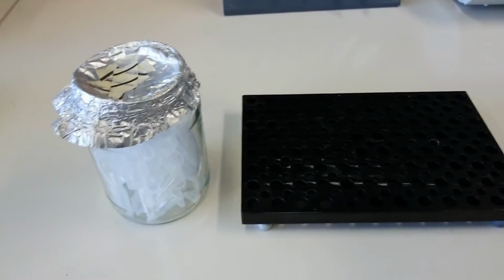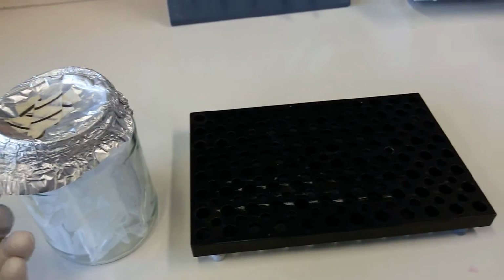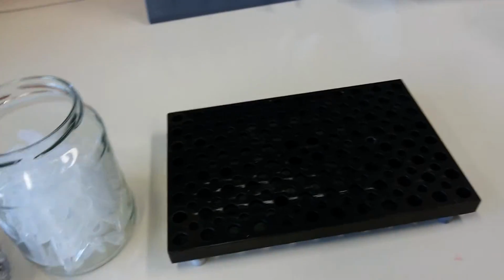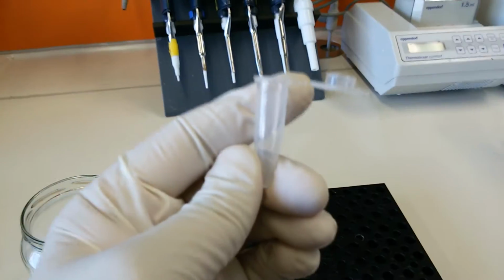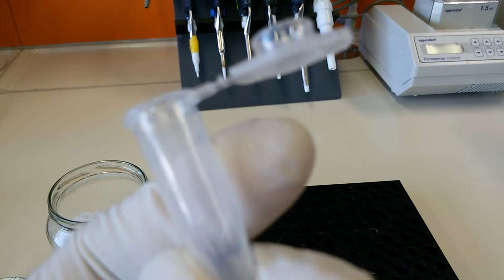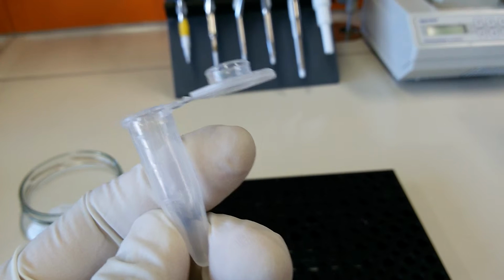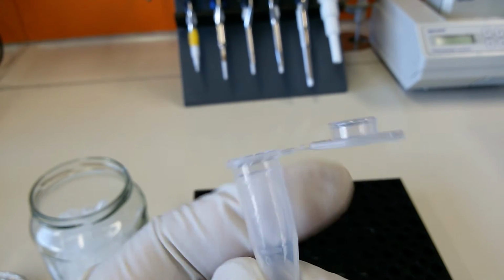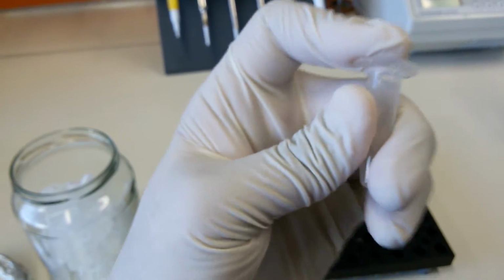This tutorial is just to make you familiar with the different terms that are common and that you should know. Now I can pick some tubes and show you what they are. So this is a 1.5 ml tube, and it's written somewhere as 1.5 ml. Let's find out where it is. Just give me a second. So you can see this is 0.5, this is 1, and this is written 1.5 ml. So this is a 1.5 ml Eppendorf tube. That's how we do it.